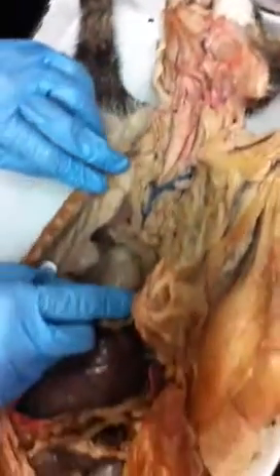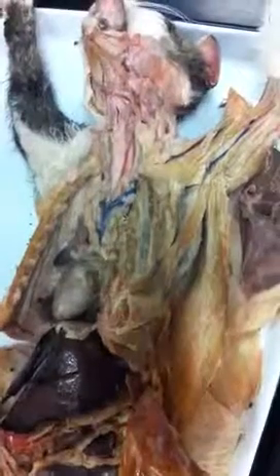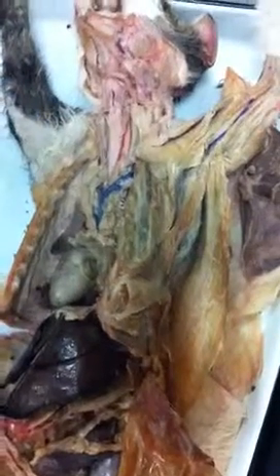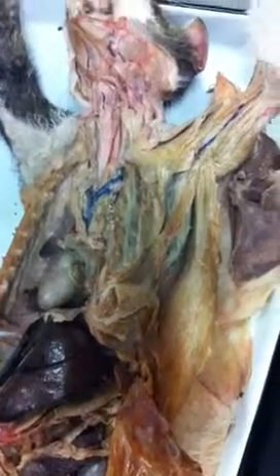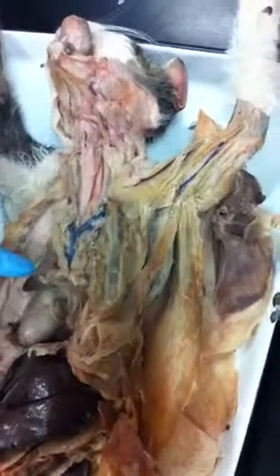What you don't have, though, is a thymus. Thymus is another gland that is in this area. I don't know if you had one and it's gone. Glandular tissue is pretty fragile, so you get a lot of people mucking in here. But if this is an older cat, it wouldn't be there anyway, because as we age, it degenerates and goes away. So it might not have had one to begin with.